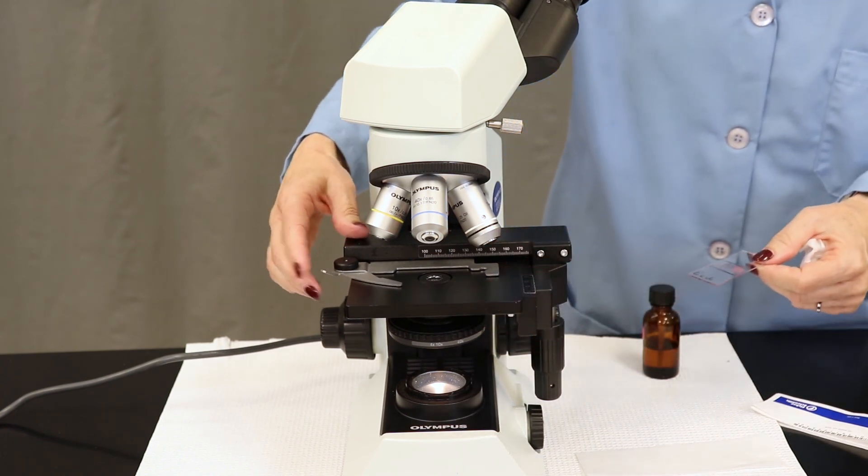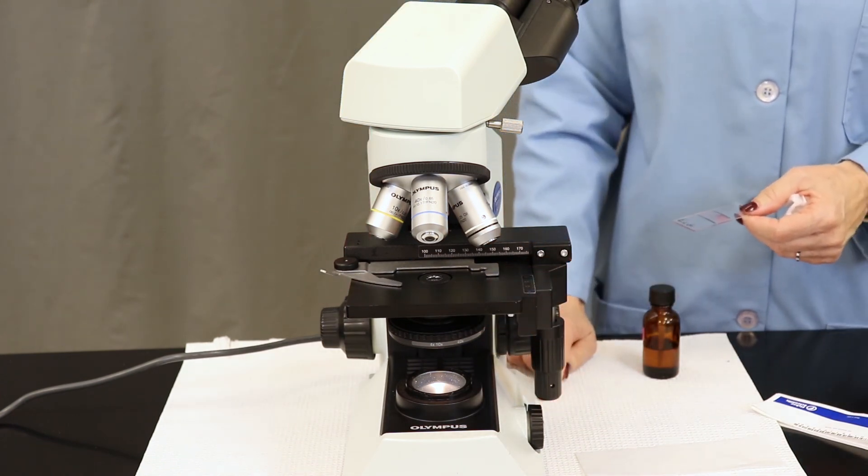If you did accidentally get oil on the 40x or any other objective, please notify your instructor.